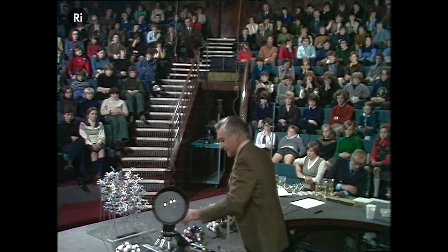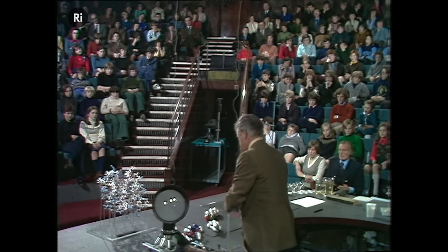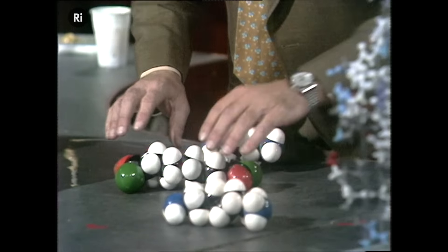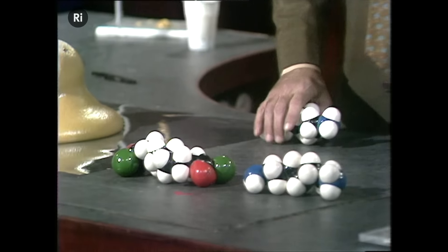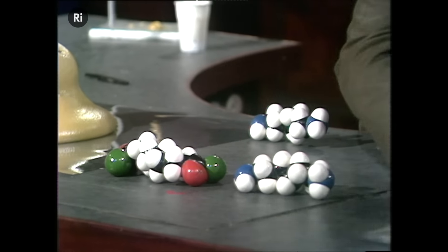And he took molecules, which are rather not quite the same as this. There are a number of ways of making nylon. These are the ones I'm going to take to make nylon and to show you this.